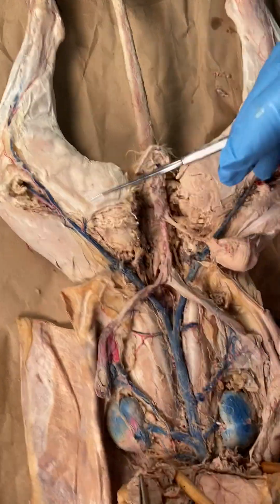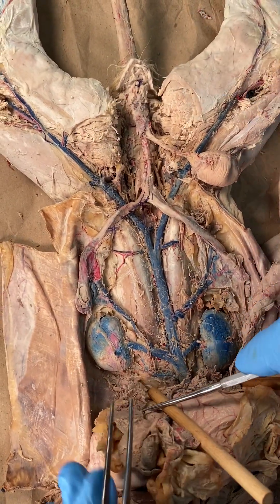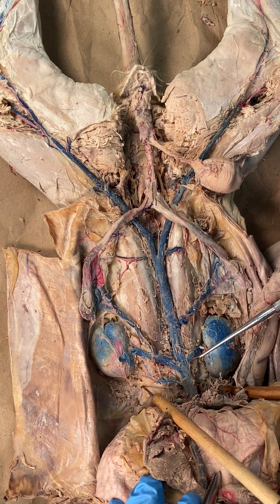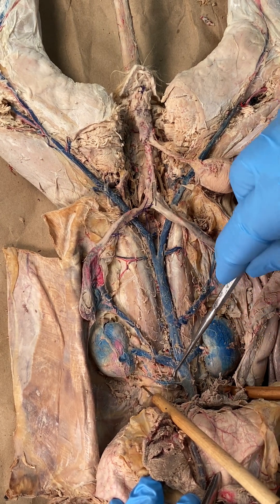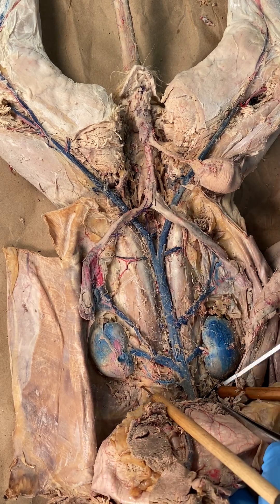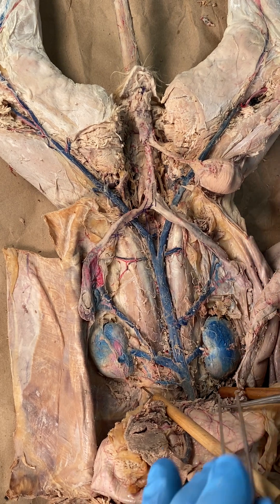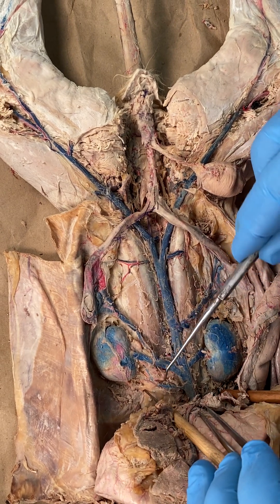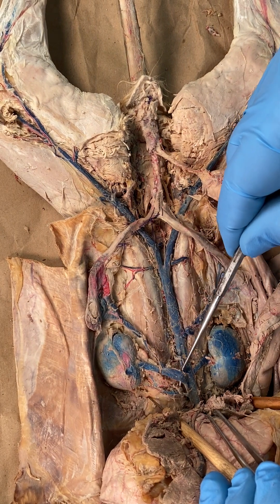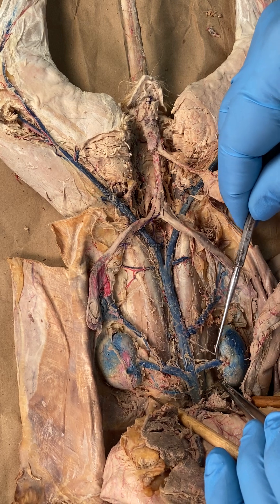I'm not going to leave this cat right now because it's got some nice veins to look at. Way up here, off of the inferior vena cava — that's the inferior vena cava — that's the left adrenal lumbar. The right one is up there, but it's so far superior and under the liver we can't see it on that side. There's the left renal and here's the right renal — they go to the kidneys, that's why they're called renal.